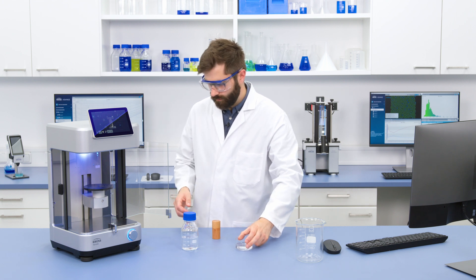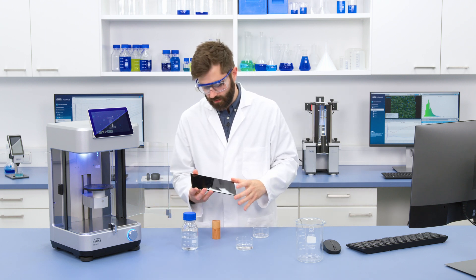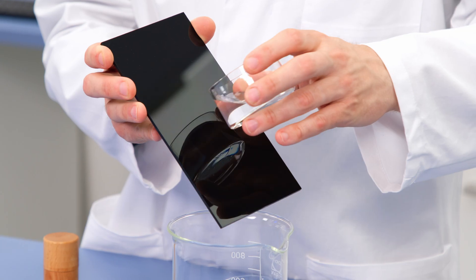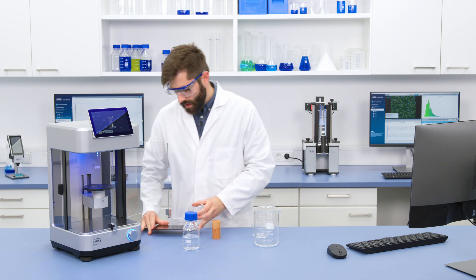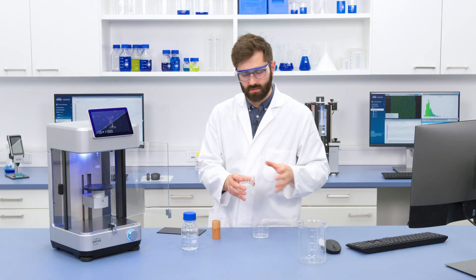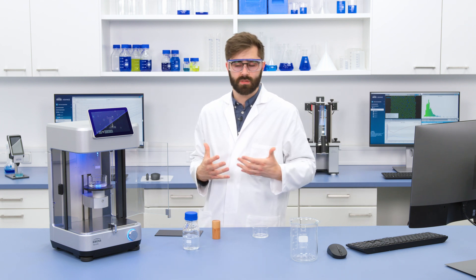At this point I take out the solid sample I want to test — this is a PMMA plate. I take the clean water I just tested and run it over the surface of the PMMA plate, so the water picks up any contamination that might be on the sample, such as detergent, surfactant, or other surface-active agents. I then put this water back in my sample vessel. I want to see whether the surface tension has changed between the first measurement and this second one.